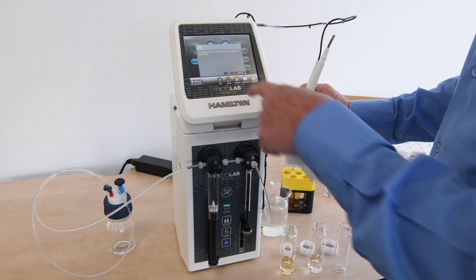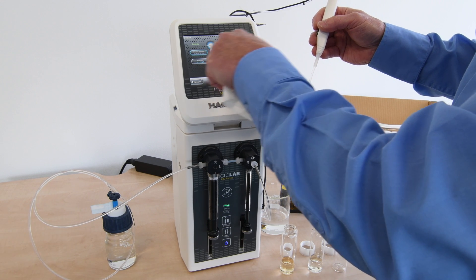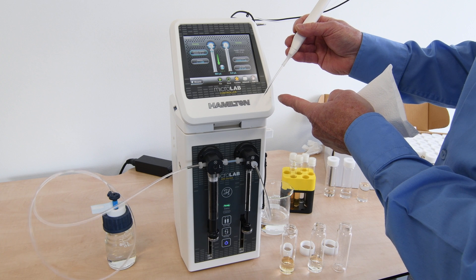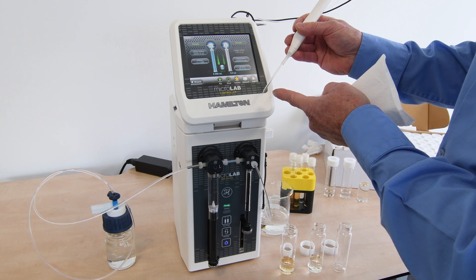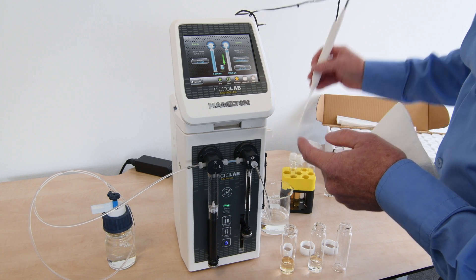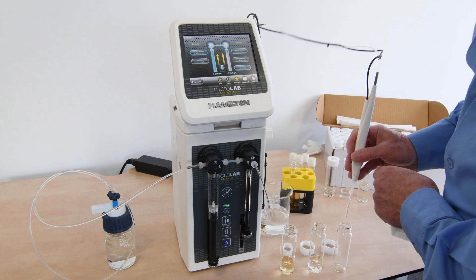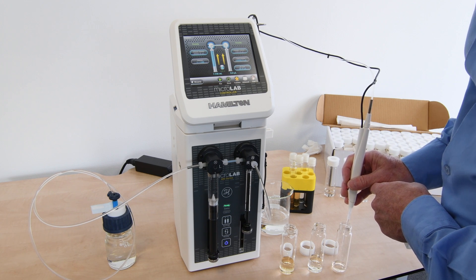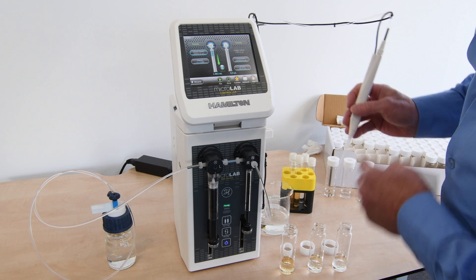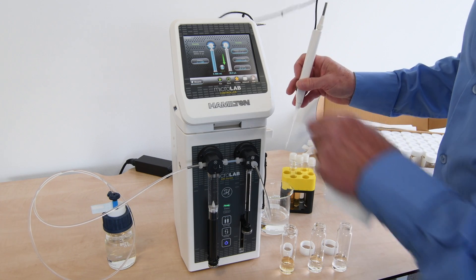Changing the ratio to 1 in 100, the sample volume and diluent volume are automatically adjusted, maintaining the 10 mL total. The first sequence aspirates the diluent and air gap, then the operator aspirates the sample, picks up the air gap, wipes the tip, and dispenses into the container. Here we have our three dilutions — 1 in 10, 1 in 50, and 1 in 100 — all to 10 mL volumes.